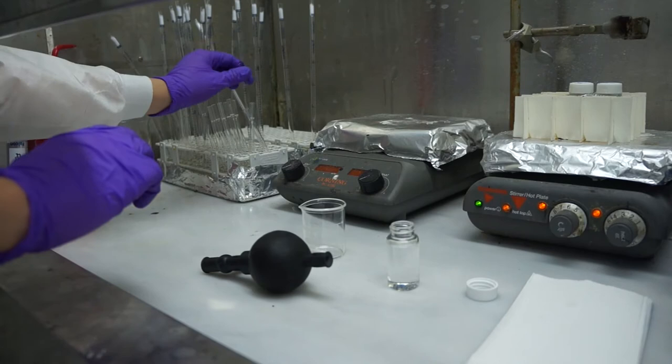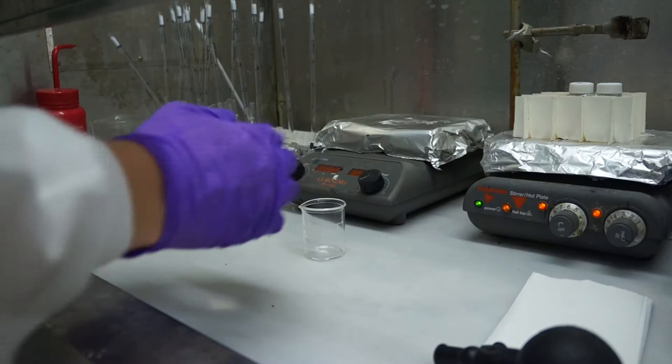Before the glass pipette can go to glass waste, it also needs to be completely dry. So place your used pipette in the drying rack in the back of the hood. Don't worry about emptying the drying rack, a designated person will do that.